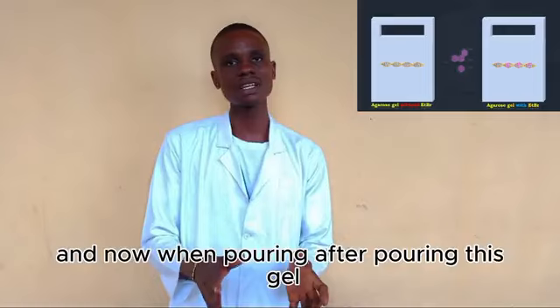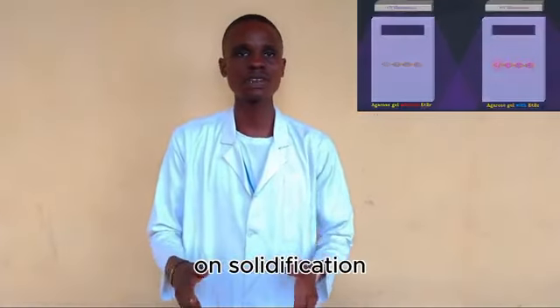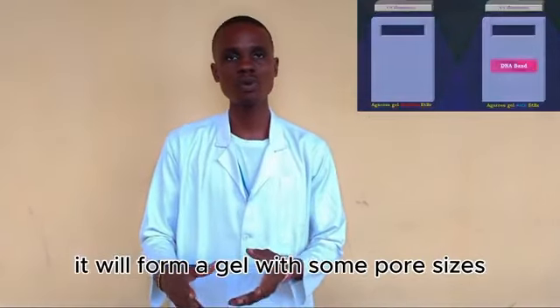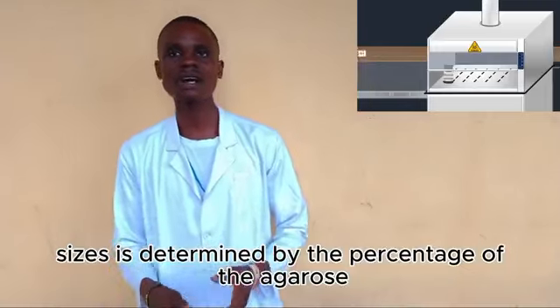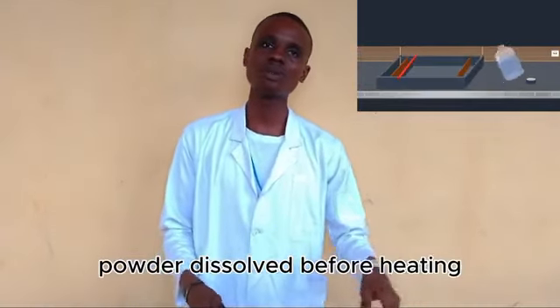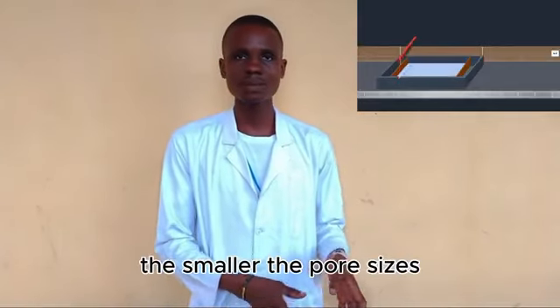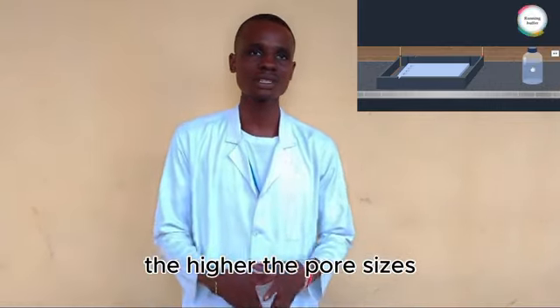After pouring this solution into the casting tray, on solidification it will form a gel with some pore sizes, and the pore size is determined by the percentage of the agarose powder dissolved before heating. The higher the percentage of agarose powder dissolved, the smaller the pore sizes, and the lower the percentage, the larger the pore sizes.